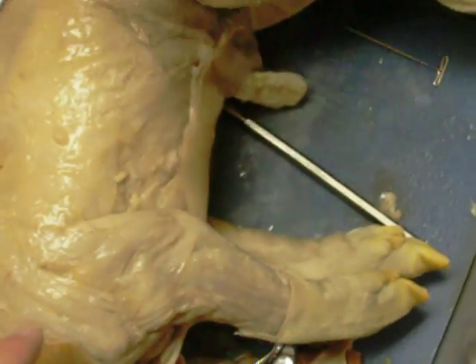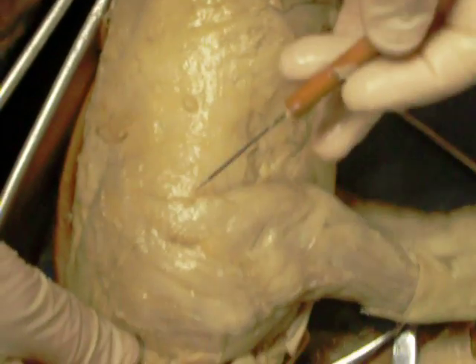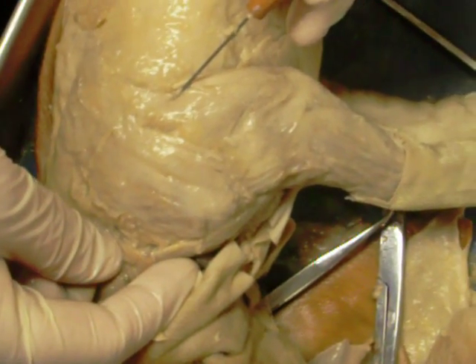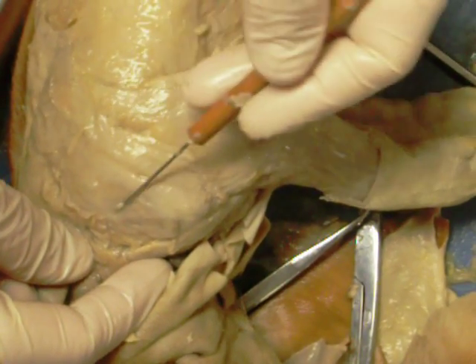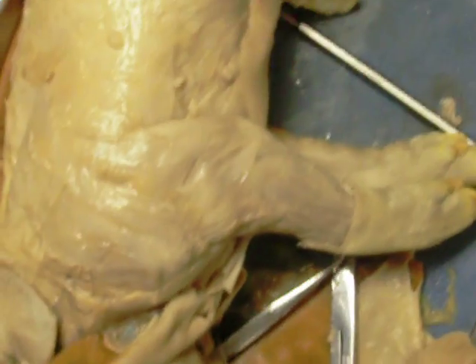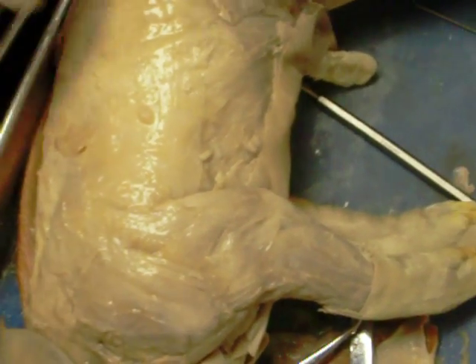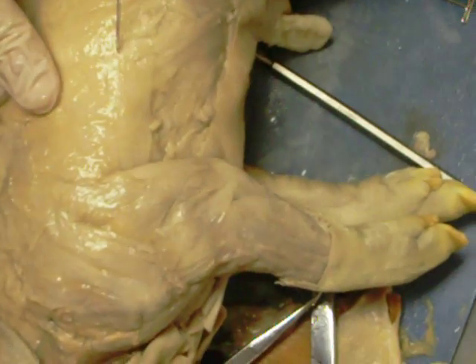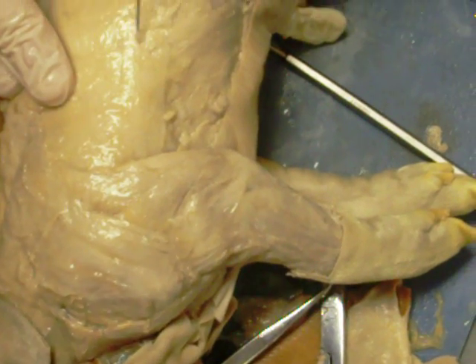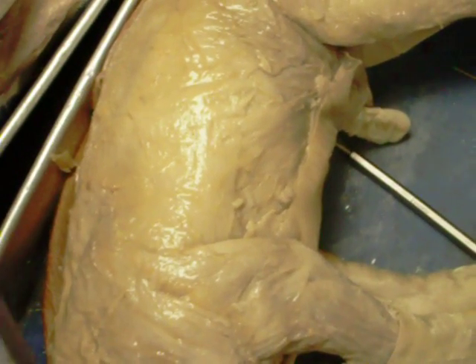The deltoid muscle is over the end of the shoulder right here. It's very similar in position to the triceps brachii — it's a little bit more anterior and connects a little bit differently. The membranes around all these muscles — the reason you can see little fibers here — is because each of those bundles is surrounded by a membrane called fascia.